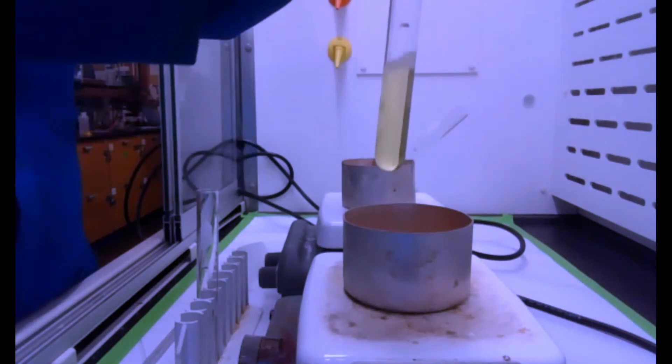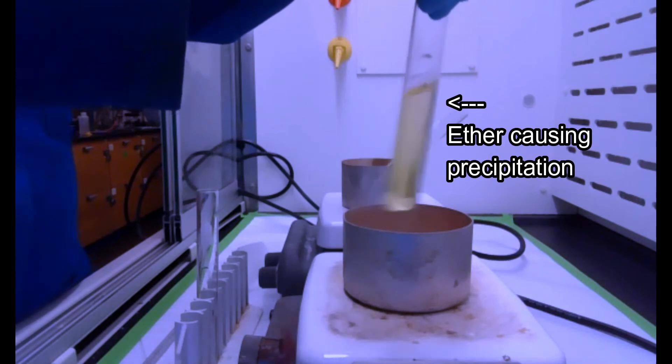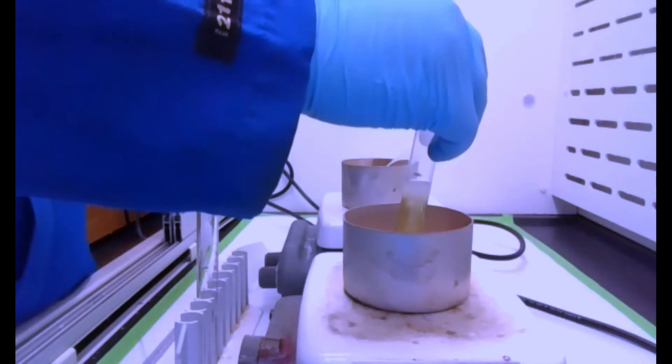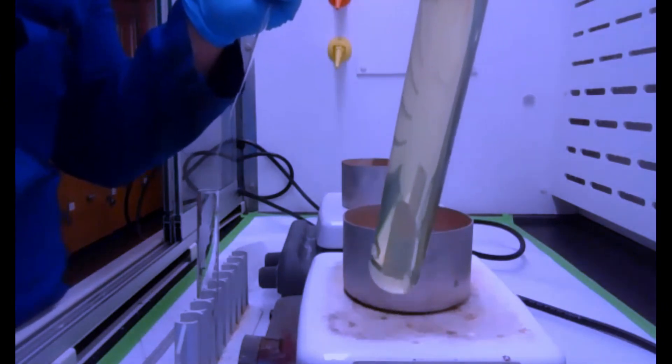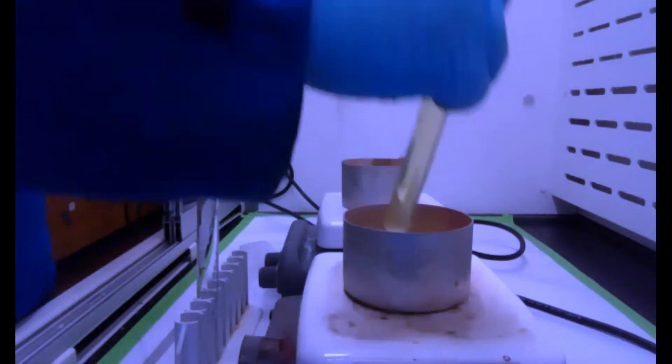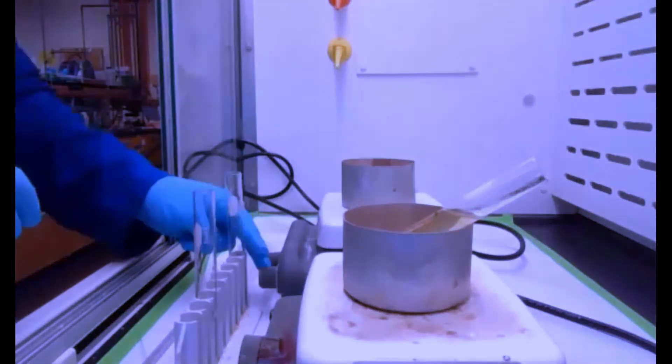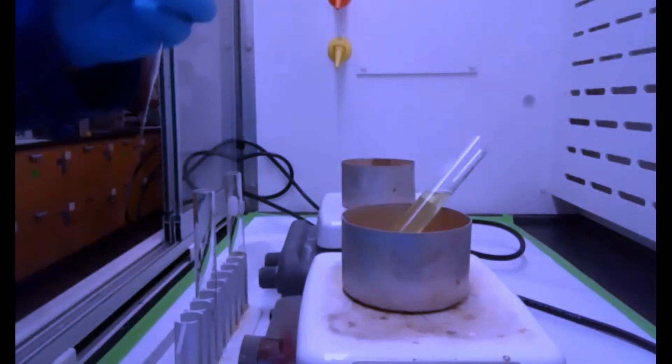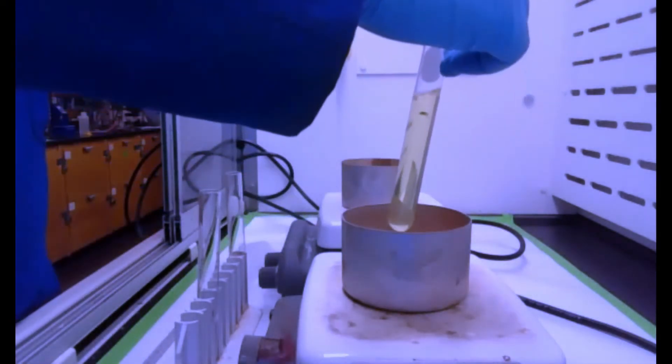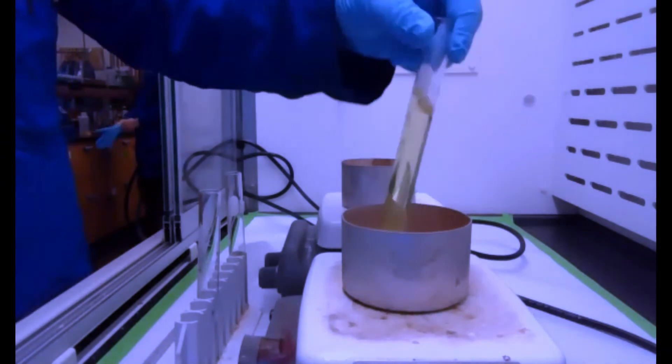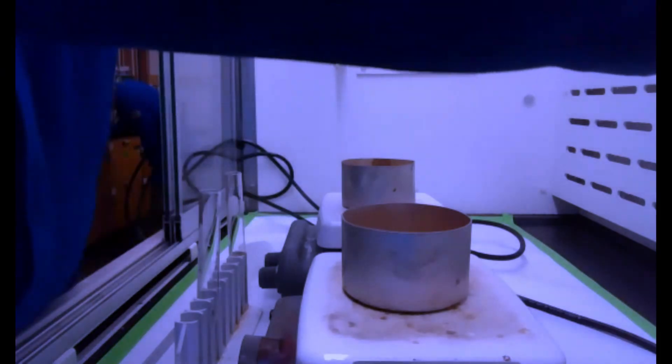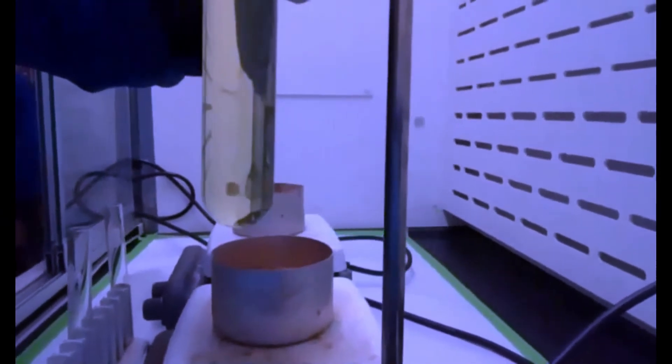You can see, as I'm adding it up top right there, it's a little bit cloudy. So, now it's kind of starting to stay a little cloudy, I'm going to make sure that that's nice and hot still. I'm going to add just a little bit more toluene to get the cloudiness to go away a little bit. Now, I'm going to clamp this up, and just let this cool down, and we'll go ahead and add a video of it as it cools.